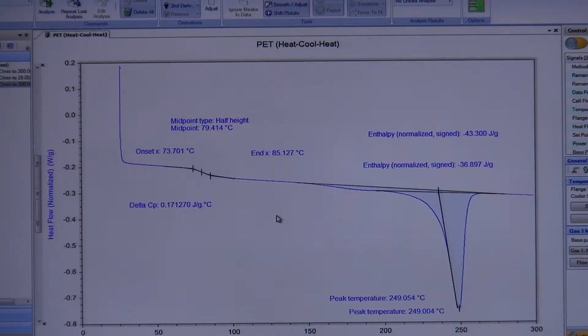Crystals, and especially when it comes to polymers, crystals form and they have different sizes. So not all the crystals are the same size. And so therefore within your melting transition you have a distribution of crystal sizes. Typically, when you see things like this, you definitely want to ask yourself what part of this is attributed to the melting curve and what part might be something different. In this case, this is actually part of your melting curve.